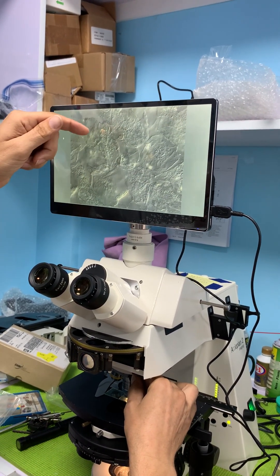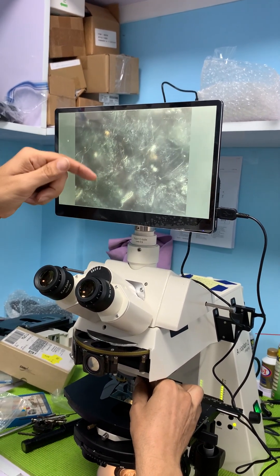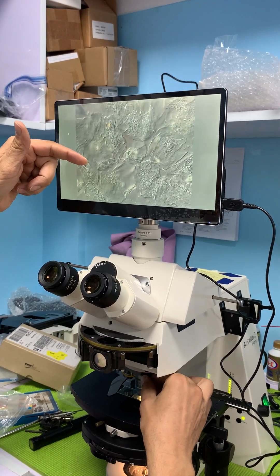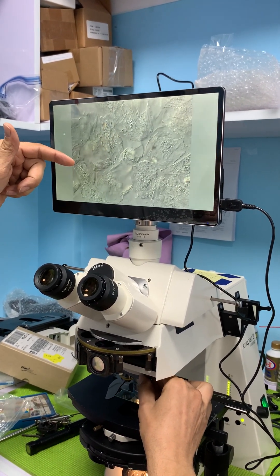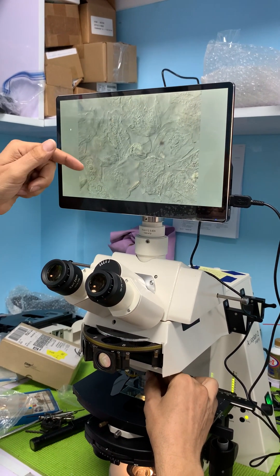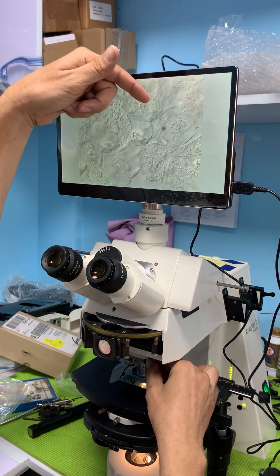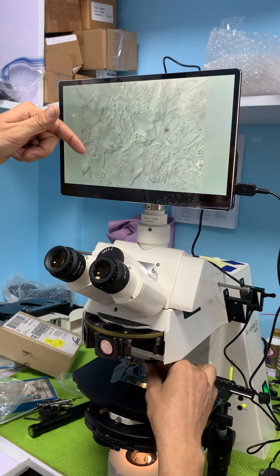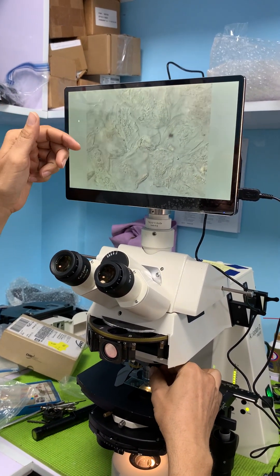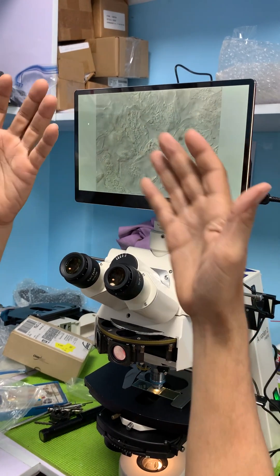We're getting a lot more contrast right now. We go through a pseudo dark field phase — I'd call this more of a positive bias on this side. If you look at the nuclei of my epithelial cells — here's a nucleus here, here, and here — they stand out at you in relief, just like an Egyptian relief on a wall where it comes out at you.